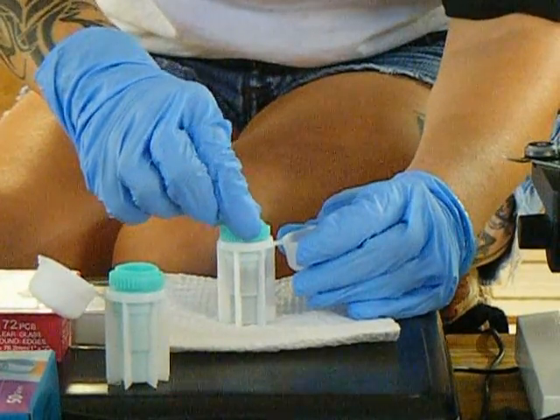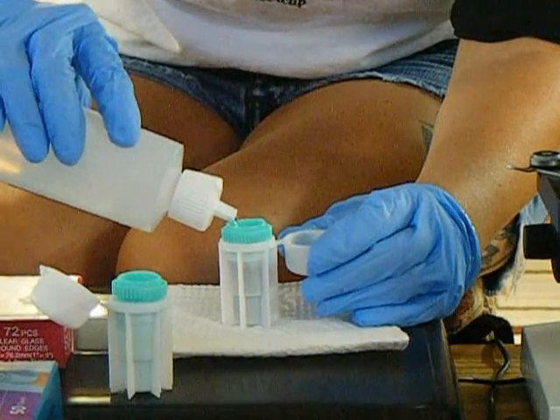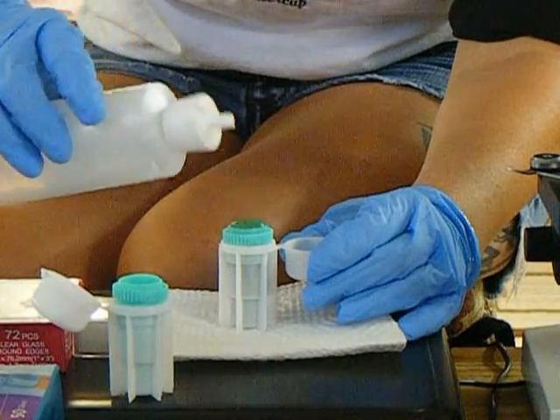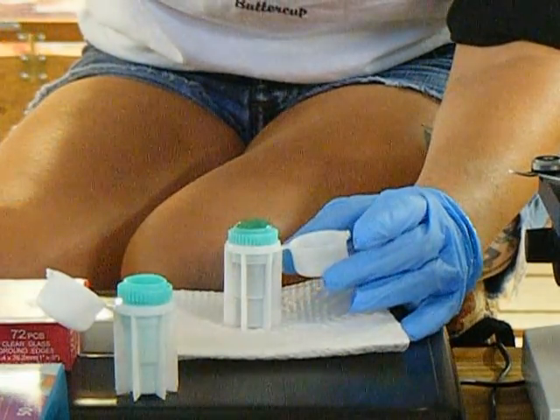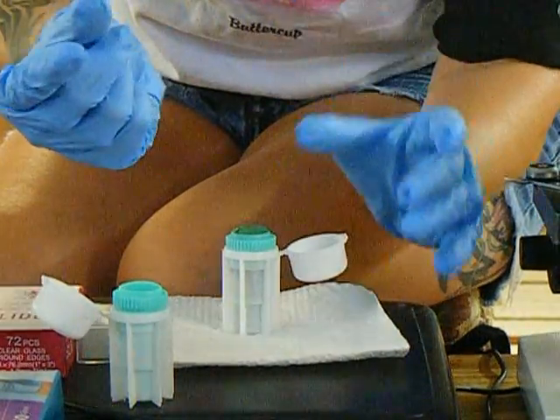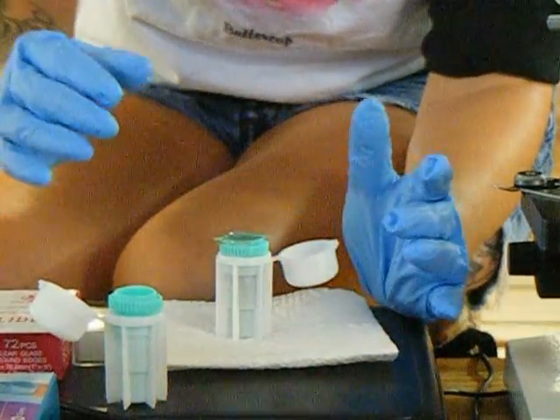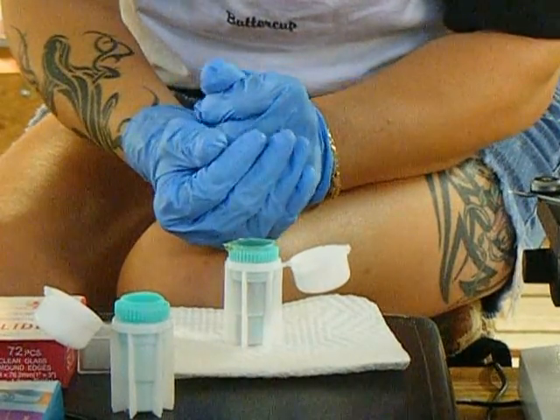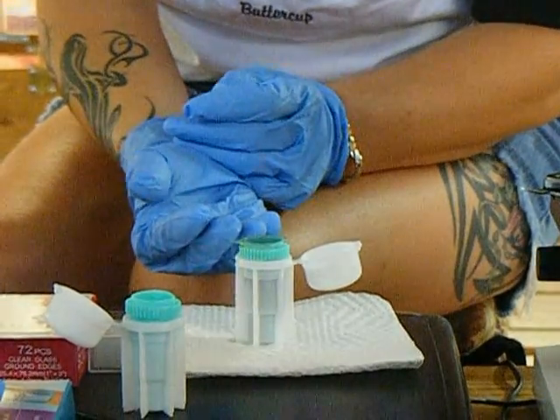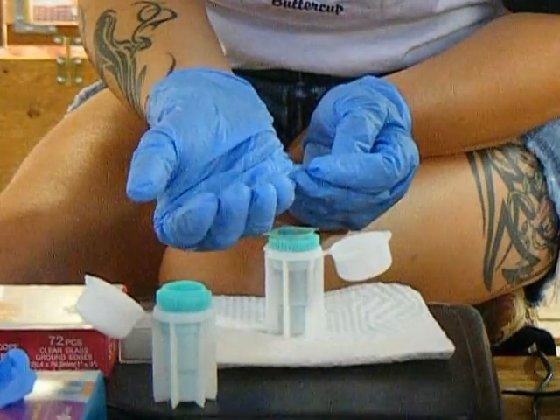Once that's done, push it down tight. Then take your fecal sol and fill it right to the rim — if a little bit overflows, that's fine, because the cover slip has to come in contact with the fecal sol. Then you take your cover slip and place it right on top of the fecal sol. What happens is the fecal matter will mostly sink to the bottom, and if there are any parasites present, they will surface and stick to the underside of the cover slip.